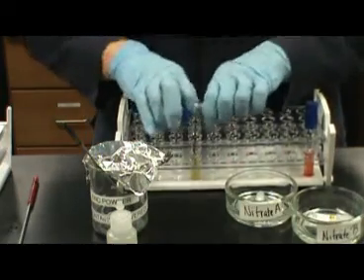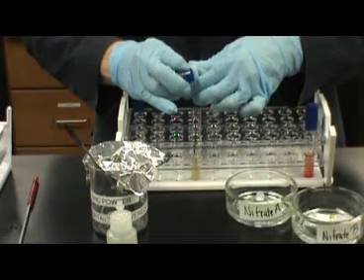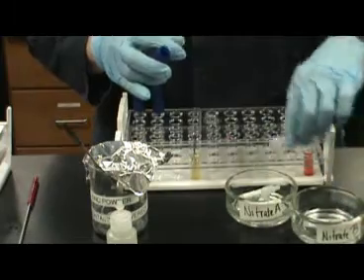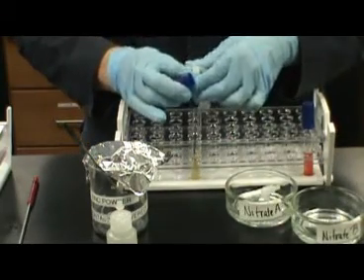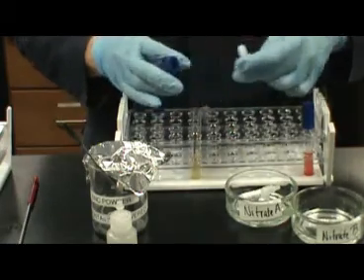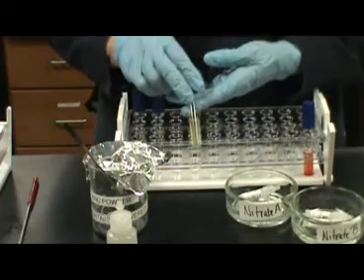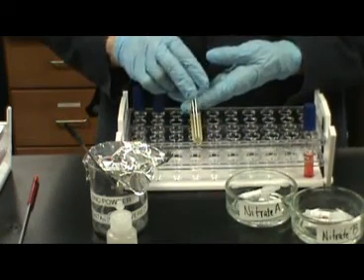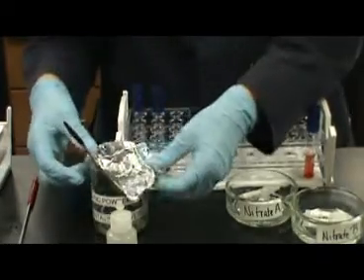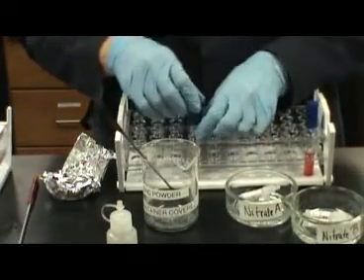If the bacteria produced nitrate reductase, the nitrate in the media will be converted again into nitrites. However, this tube does not change to a bright red after the addition of the reagents. This is due to one of 2 possible reactions. The first reaction would be no production of nitrate reductase or nitrite reductase, a second enzyme produced by some bacteria. If no enzymes were produced, this is a non-nitrate reducing bacteria. In this case, the entire test result would be negative.